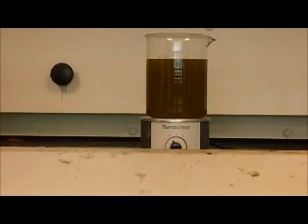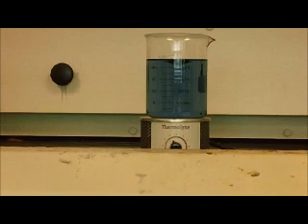Alright, so now, as you can see, something's happening, and it's turning green. And green indicates that the yellow Ce4 ions, cerium 4 ions, are oxidizing the iron in the ferroin indicator. The iron 2 is a red color, but the iron 3 ions are blue. So what it's doing is it's oxidizing the iron 2 ions to become iron 3 ions, and that'll turn the solution blue. And the transition, because of the yellow cerium, will be green, which is how you get the green that came before. Right. And that'll become blue.